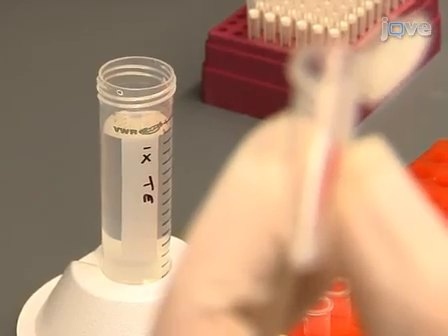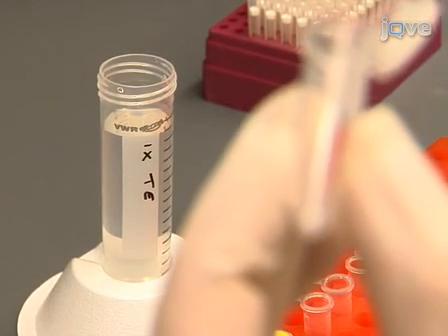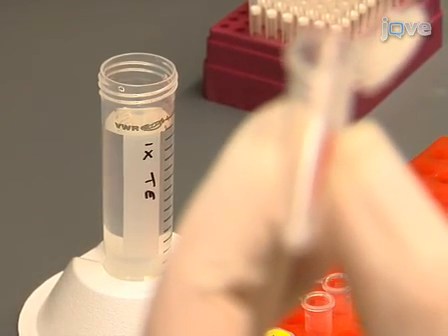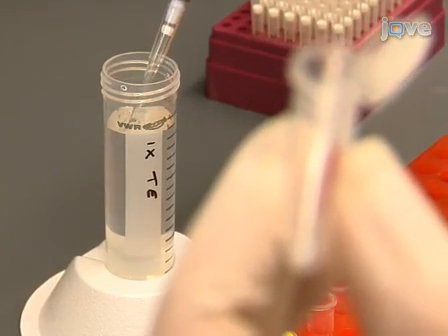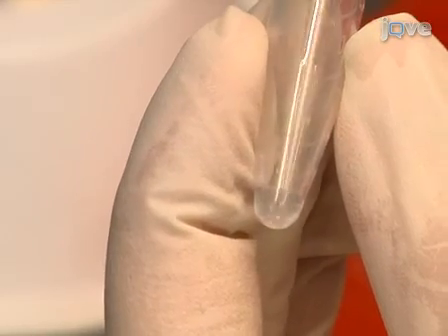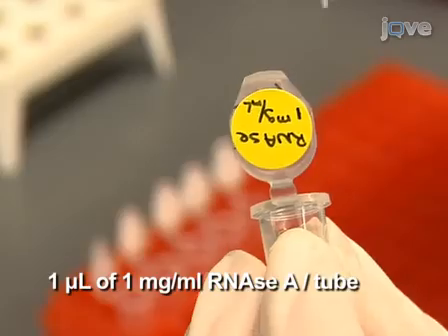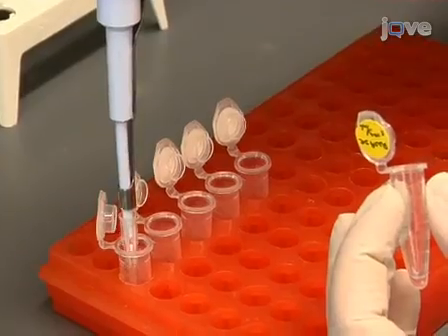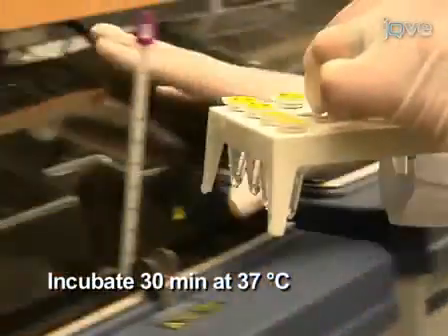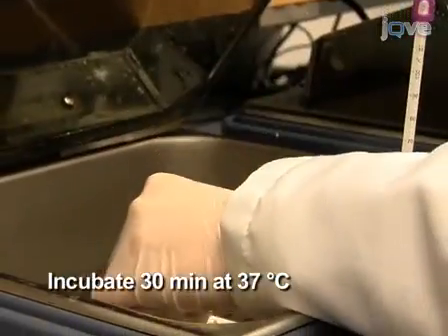After spinning down the precipitated DNA, each DNA pellet is washed once with 70% ethanol and then resuspended in 25 microliters of 1x TE buffer. Degrade any RNA that may be present by adding 1 microliter of RNase A per tube and incubating the tubes for 30 minutes at 37 degrees Celsius.